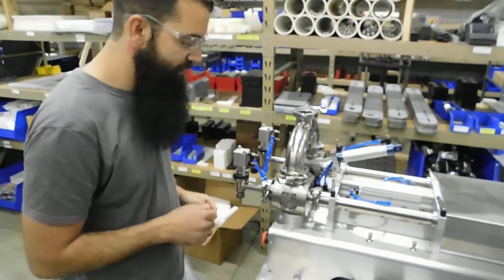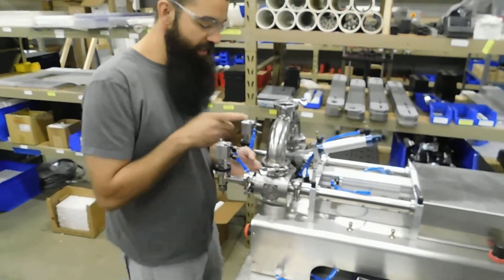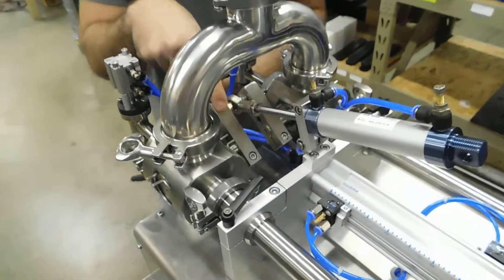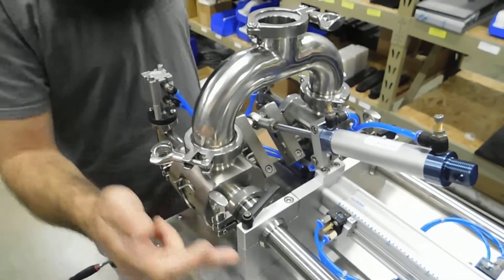Alright, we're going to show you how to re-clock a three-way valve. If you ever take one of these apart and take the actuating arm off of the three-way valve core, you can get the valve out of time compared to the way it should be when it's filling.